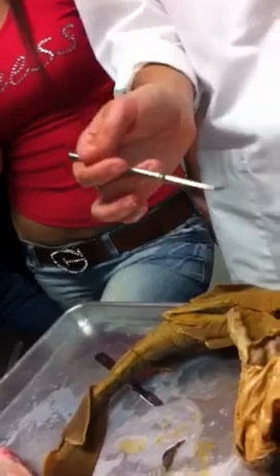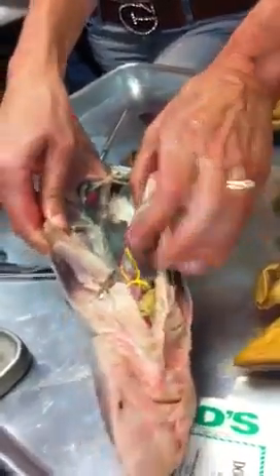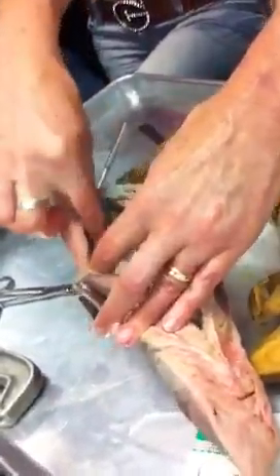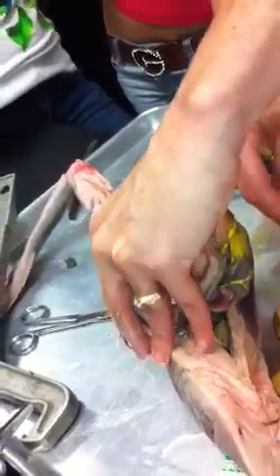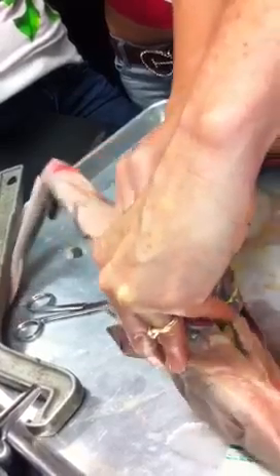So, we didn't see a female yet, but in your diagram here, the first one should be a male with the testes way up anteriorly. And the second one should be female, where, let me just look at this one. This is a male too, but let's just see what we got here. In terms of reproductive organs, the female might have a uterus. If she's not an egg layer, she might have a big uterus in which she would keep those embryos.